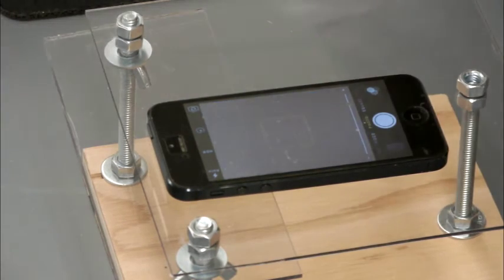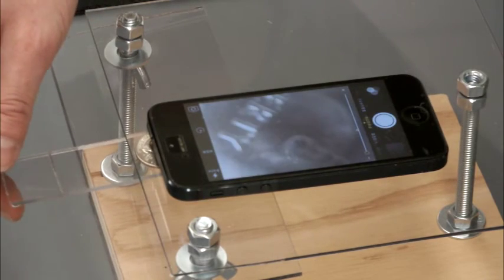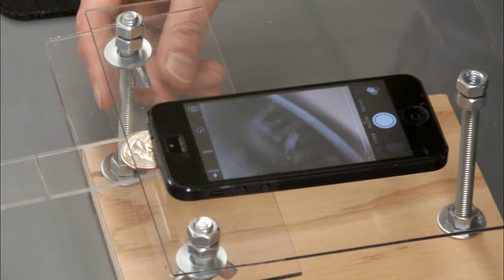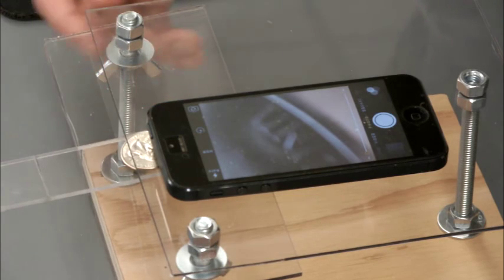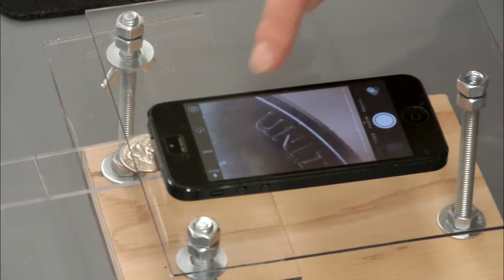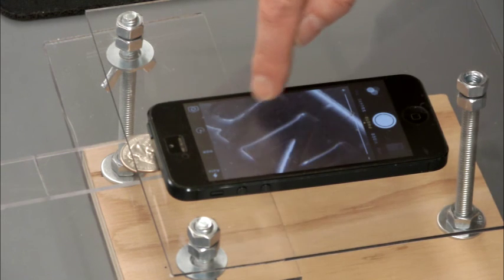And then something everyday item like a quarter. Let's see if we can get that to focus a little bit better. There we go. So you can see the little details of the edge of the quarter there. You can see the scratches. You can zoom in on that. See the detail of how the metal has been shaped.